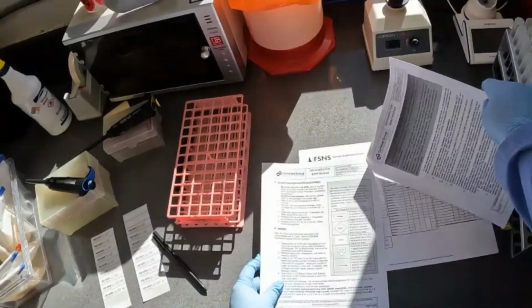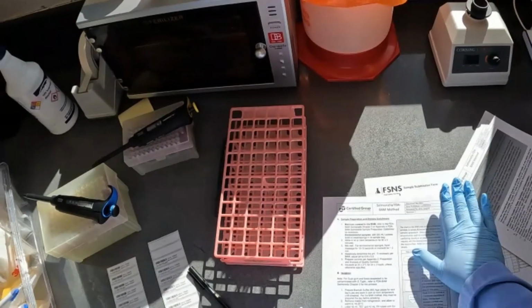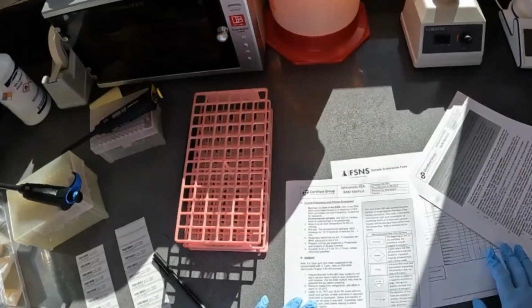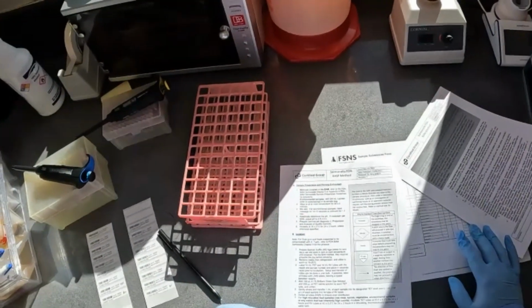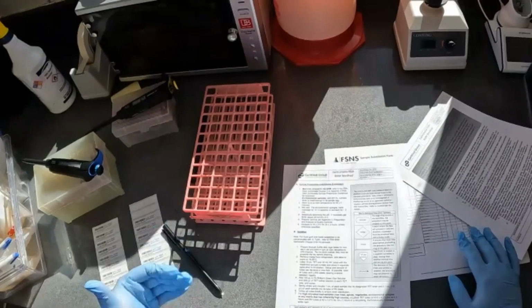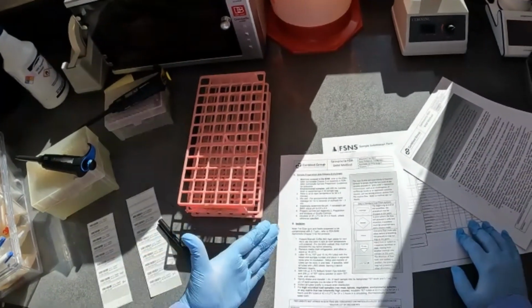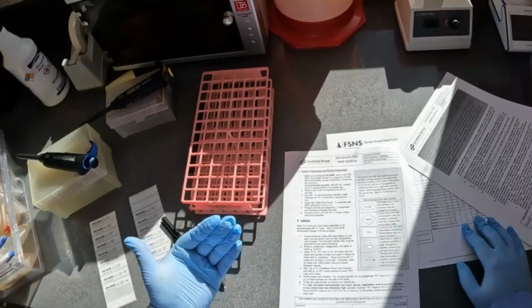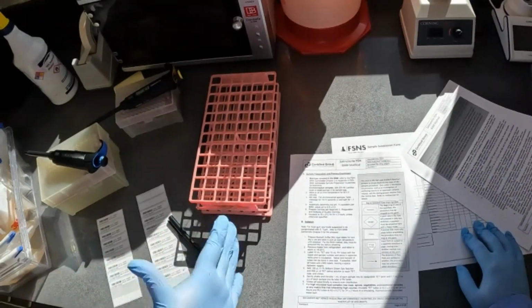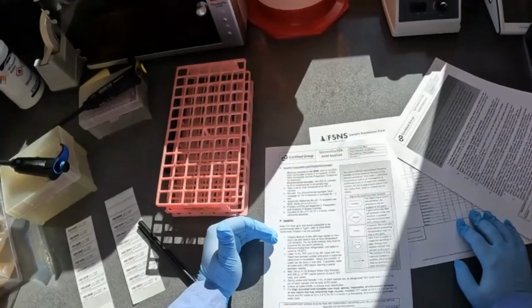From here we get into the sample preparation and primary enrichments. It does refer you directly to Chapter 5 of the FDA BAM. So you would look for those for guidelines for how to enrich a sample if you were going to test a sample directly for confirmation. So from here, if you have completed a screen and then the client requested confirmation, you would actually start here at the isolation step.